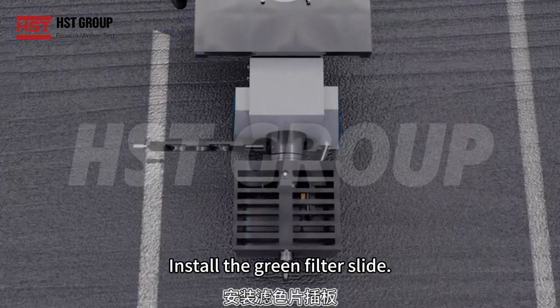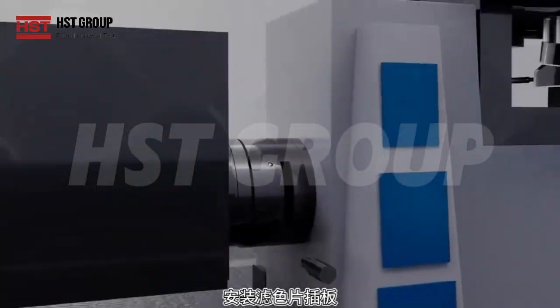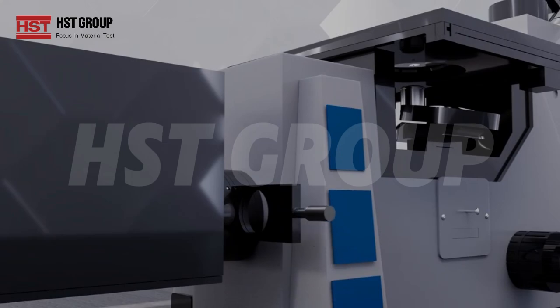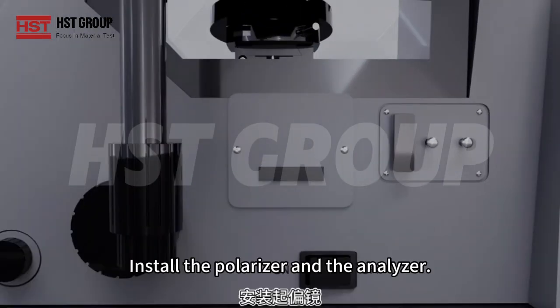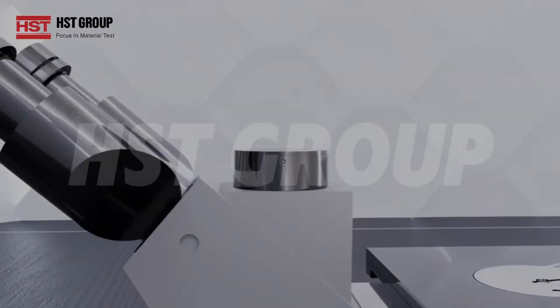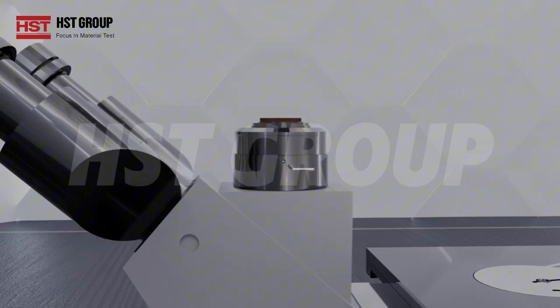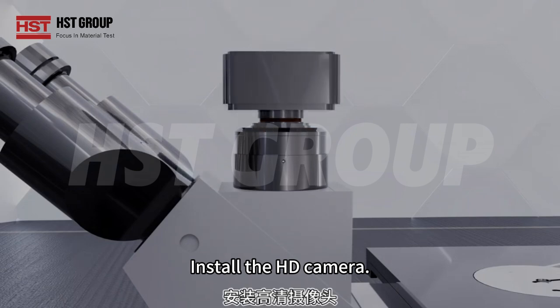Install the green filter slide. Insert the LBD filter. Install the polarizer and the analyzer. Remove the dust cover. Install the adapter interface. Install the HD camera.